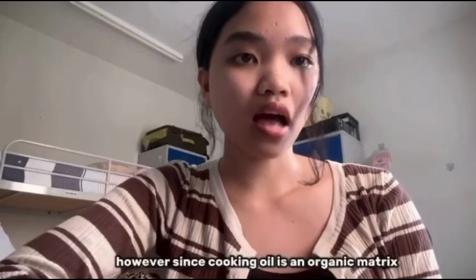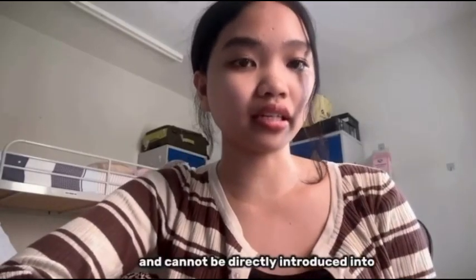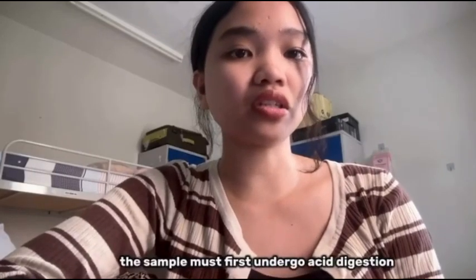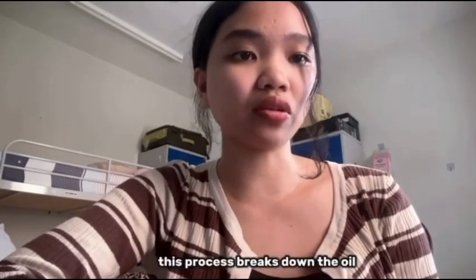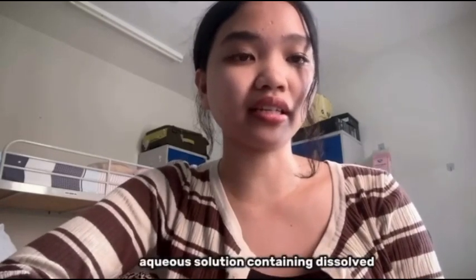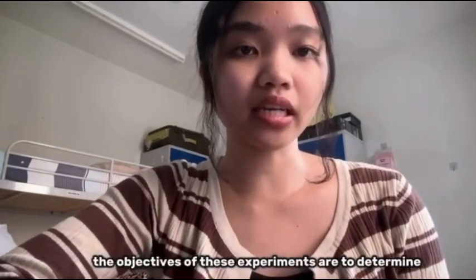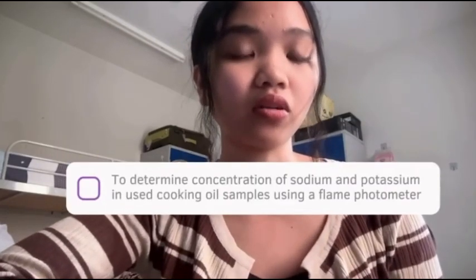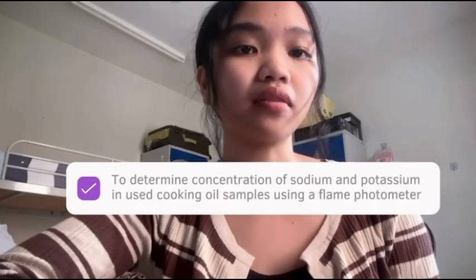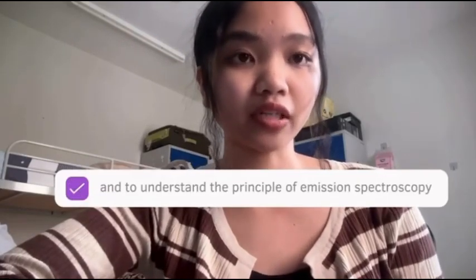However, since cooking oil is an organic matrix and cannot be directly introduced into the flame photometer, the sample must first undergo acid digestion. This process breaks down the oil and converts it into an aqueous solution containing dissolved sodium and potassium ions. The objectives of this experiment are to determine the concentration of sodium and potassium in used cooking oil samples using a flame photometer and to understand the principle of emission spectroscopy.